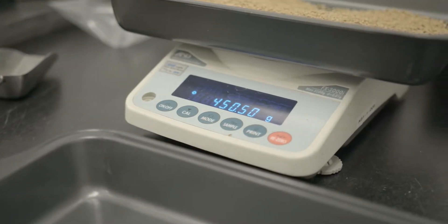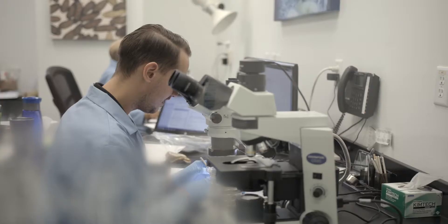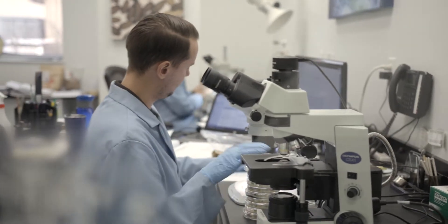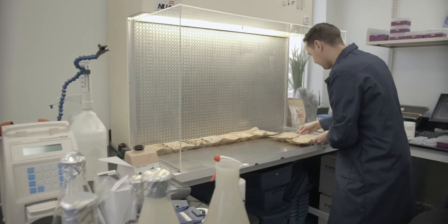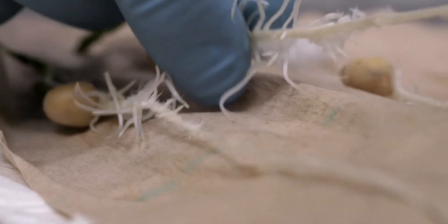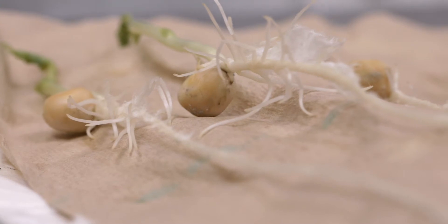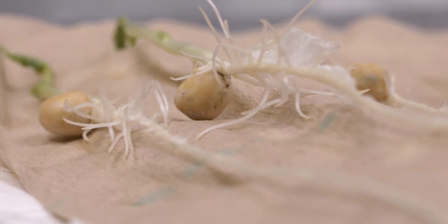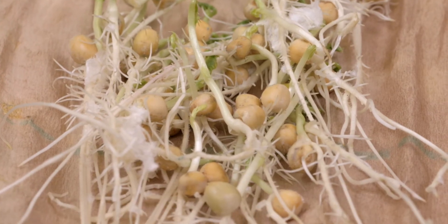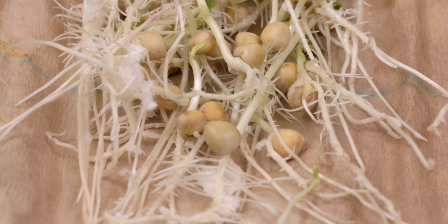Why is this preliminary or harvest germination test so pivotal to quality? A germination test reveals many keys to the history of your crop. For example, in this case we can determine that the growing season for this crop, especially leading up to harvest, was good. The bulk of the seedlings are normal and healthy.